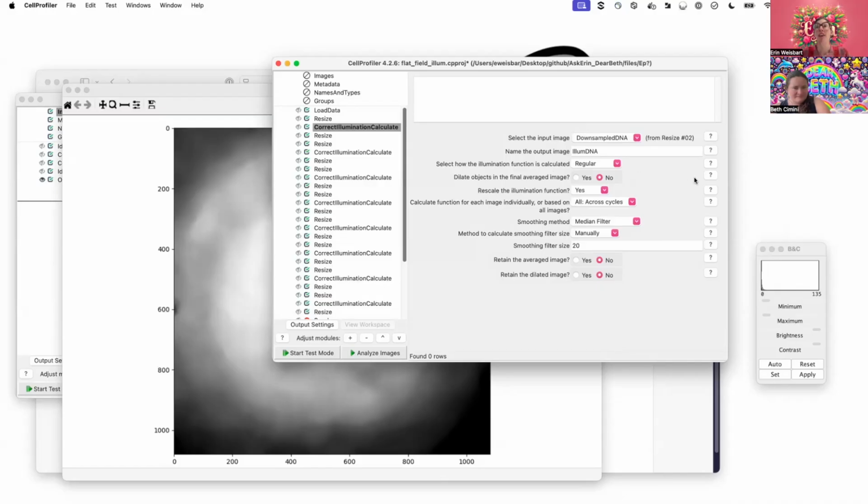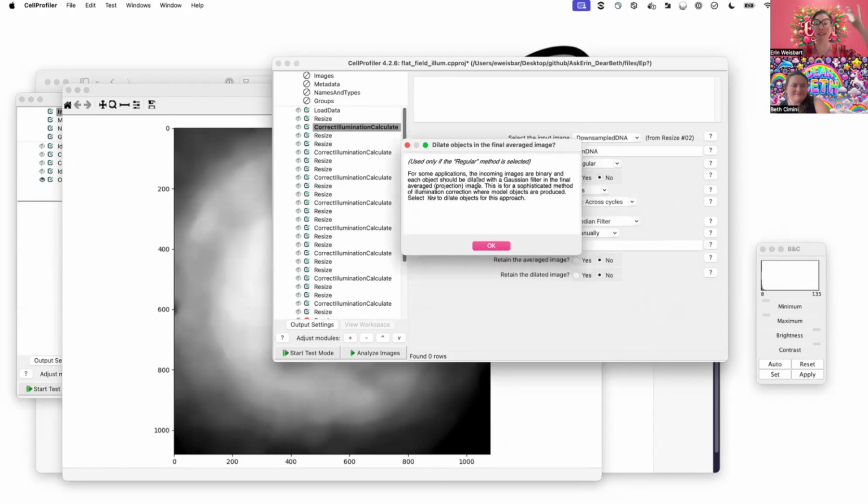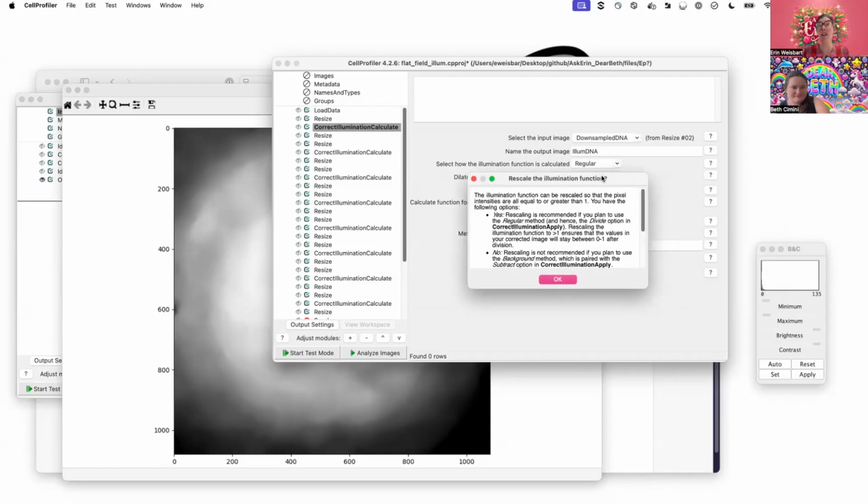This dilate objects setting is not a normal thing that one does, so you can just keep it off. We don't have model objects. What we do want is to make sure we rescale this illumination function.